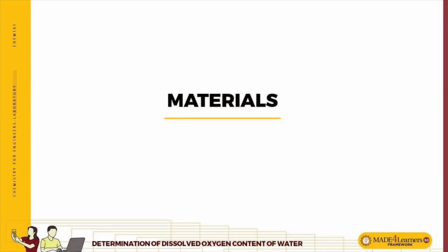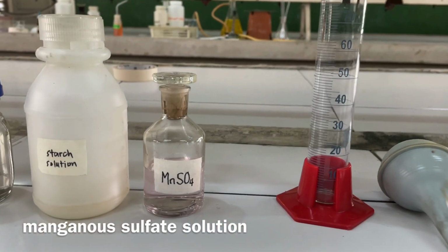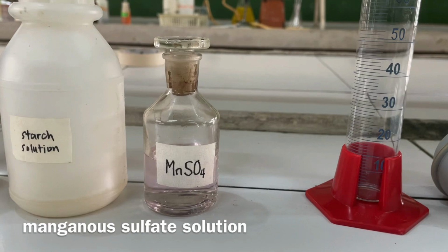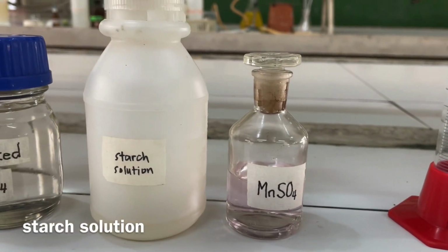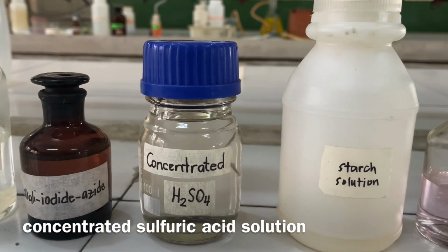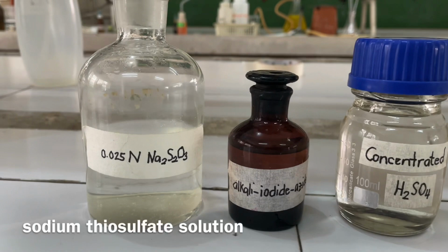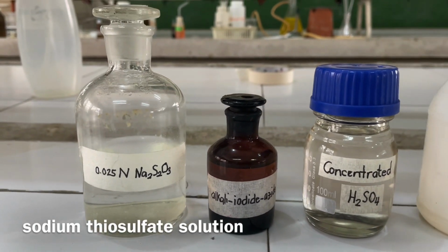The materials needed in this experiment are manganese sulfate solution, starch solution, concentrated sulfuric acid solution, alkaline iodide azide solution, and sodium thiosulfate solution.